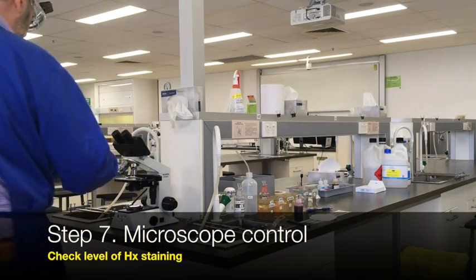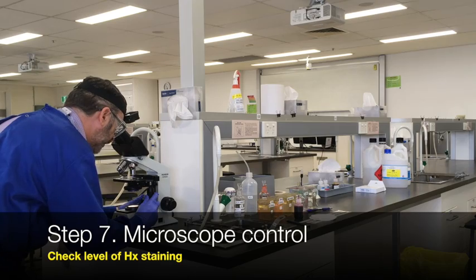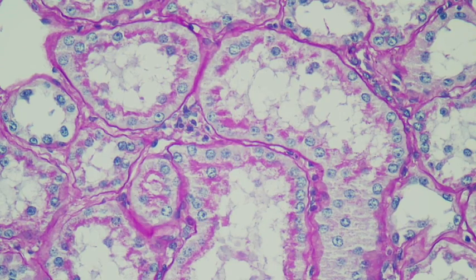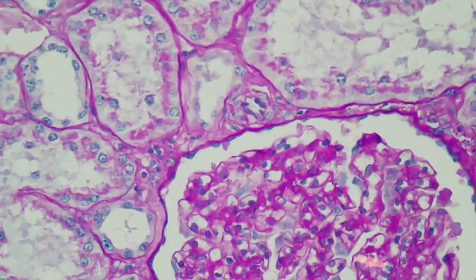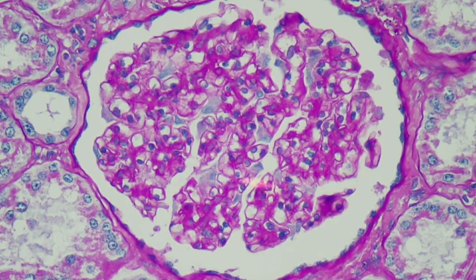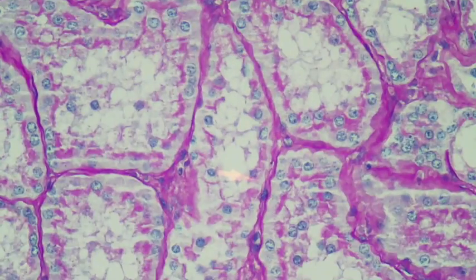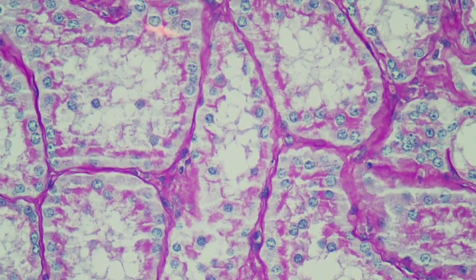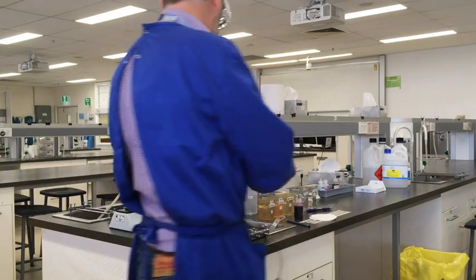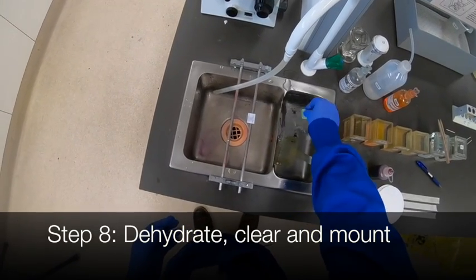Let's take the first slide over and have a look — this is the kidney. We can see there are some really nice magenta-colored basement membranes. The section probably could have been cut a little bit thinner to get more detail, but within the glomerulus there's quite intense staining of the basement membranes, which have clearly reacted with the PAS. The nucleus staining looks pretty good — those nuclei look quite clear and distinct. If you overstain, the cytoplasm can start to look a bit blue as well, but that looks just about right.